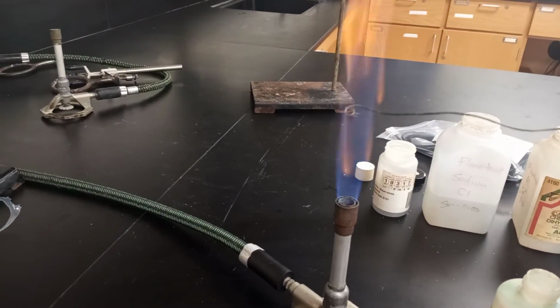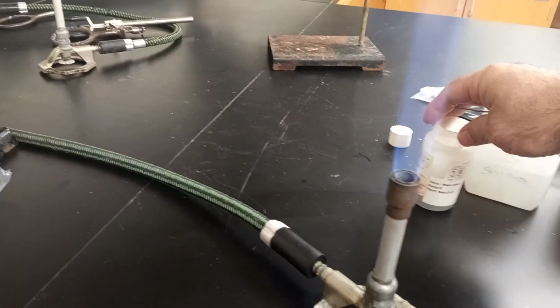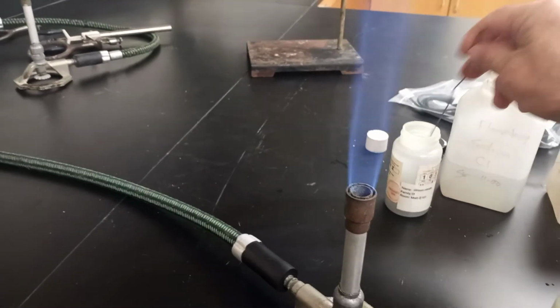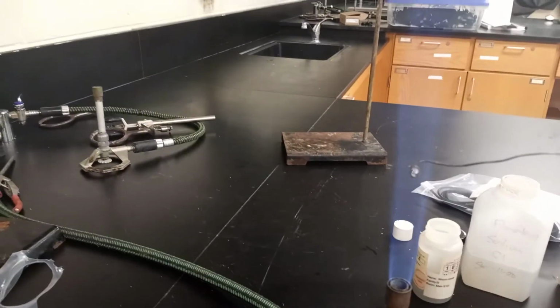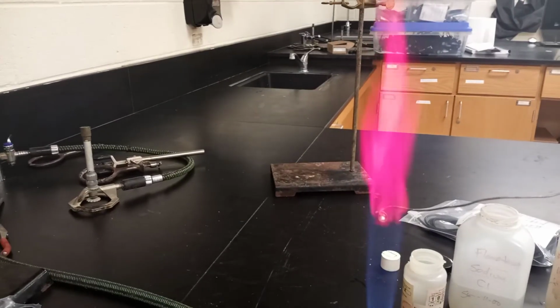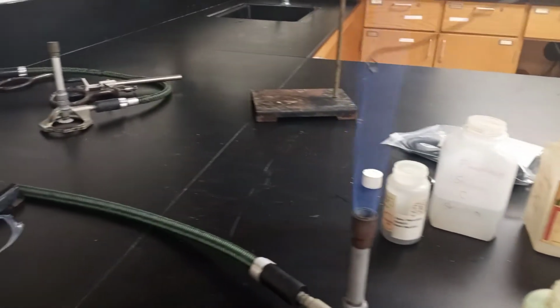All right, get a little color here. There's a lot of residual chemicals there. Go right into this. And the first one, for your own purposes, is lithium. Lithium is the cation. So on your chart, you can write down lithium and record down the color. And the color is a nice sort of purplish reddish color. There we go, one's done. We're going to just keep going. Clean it off. All right.